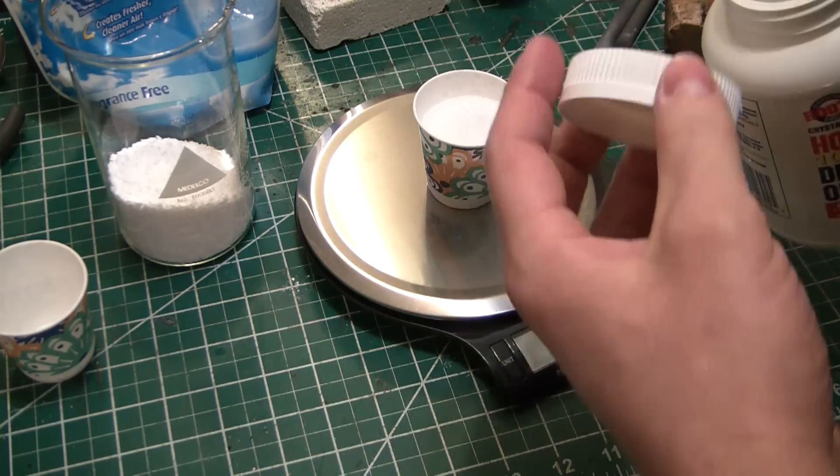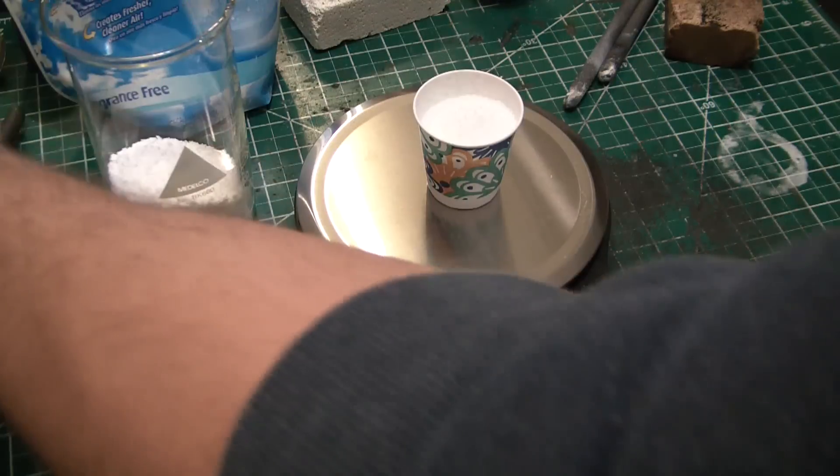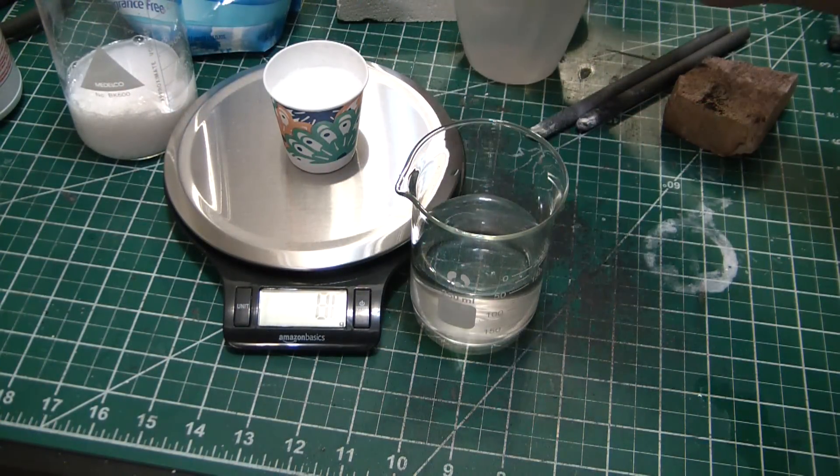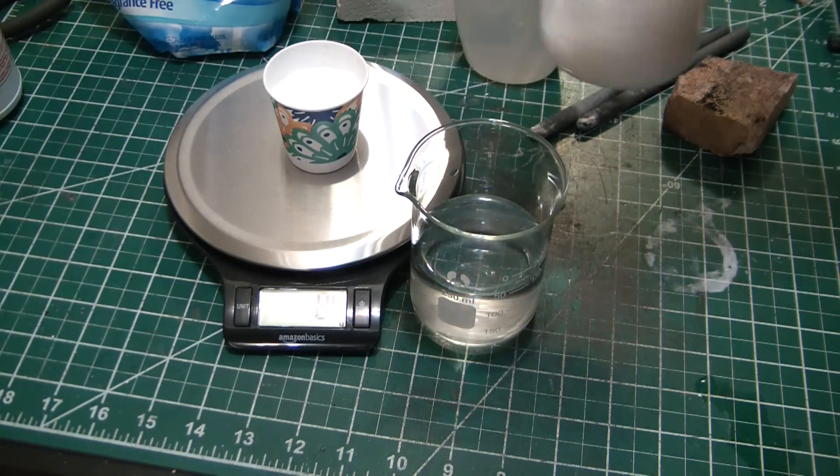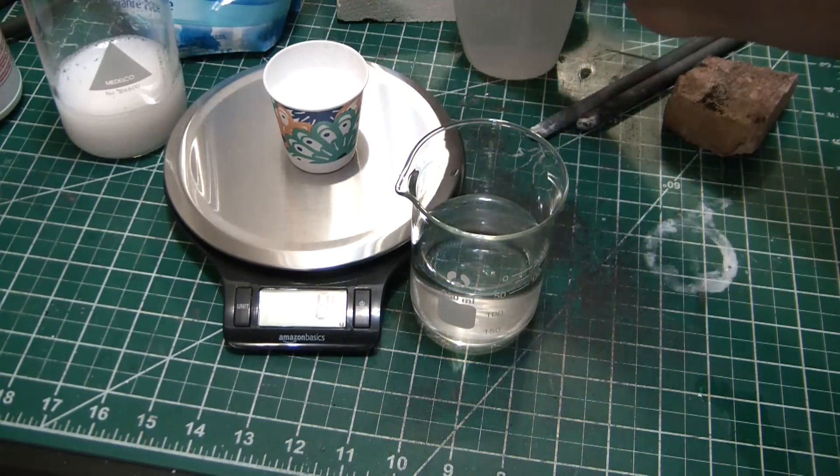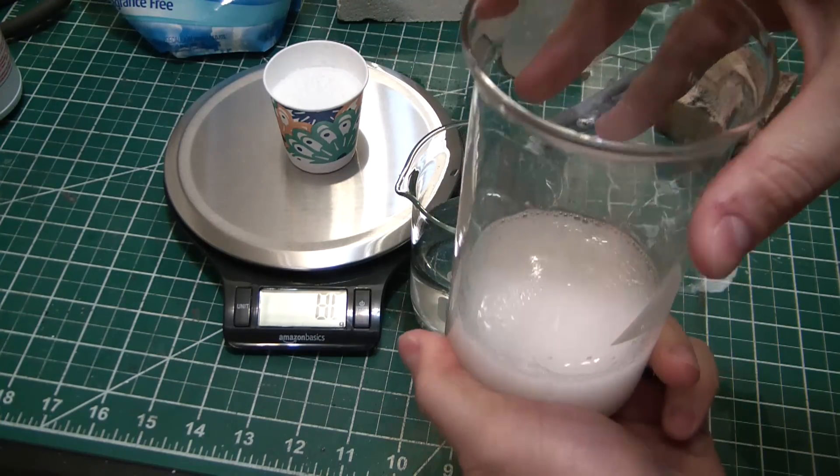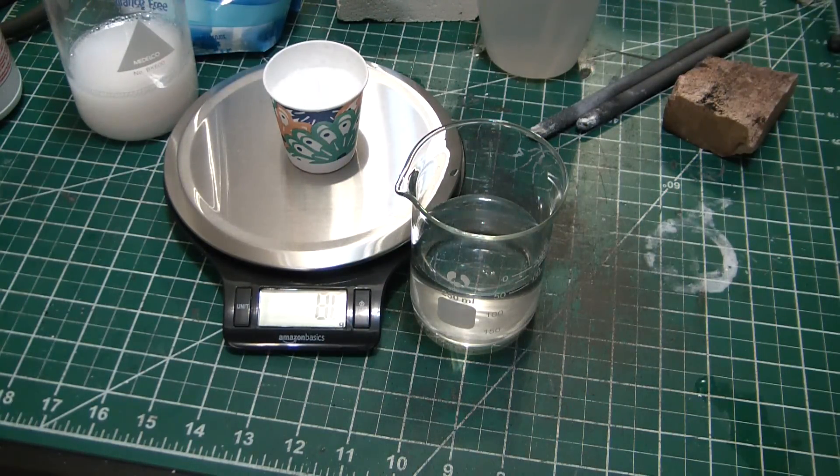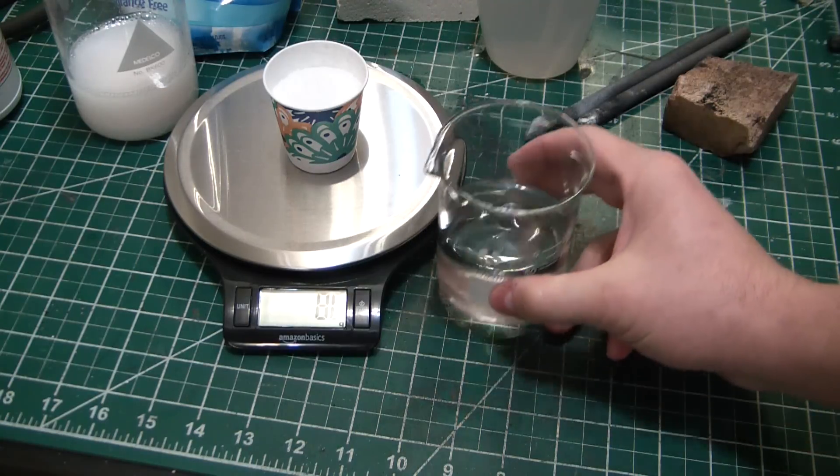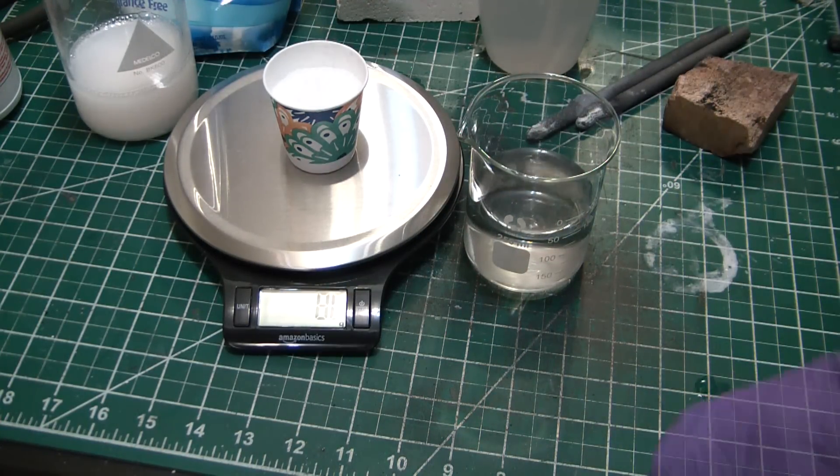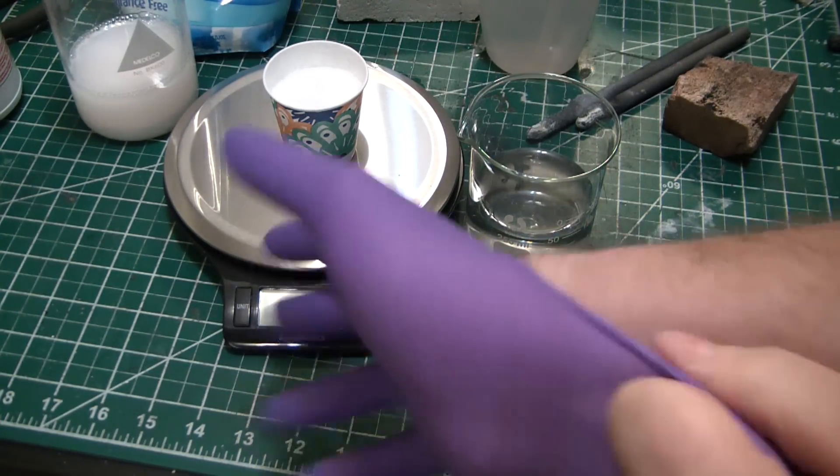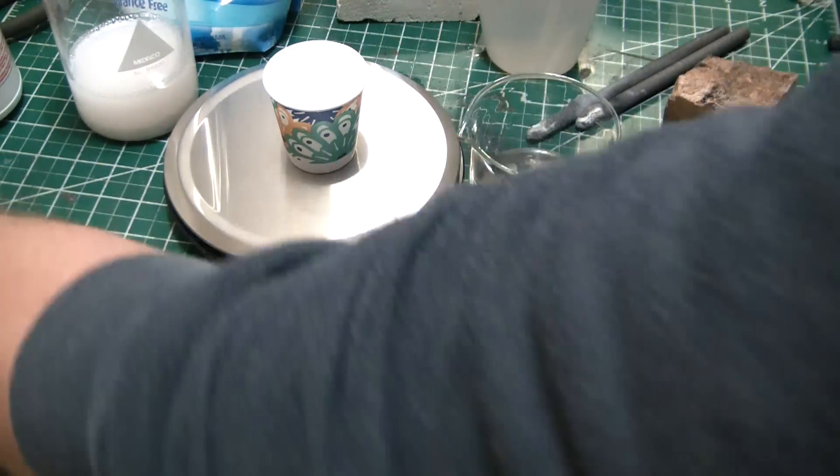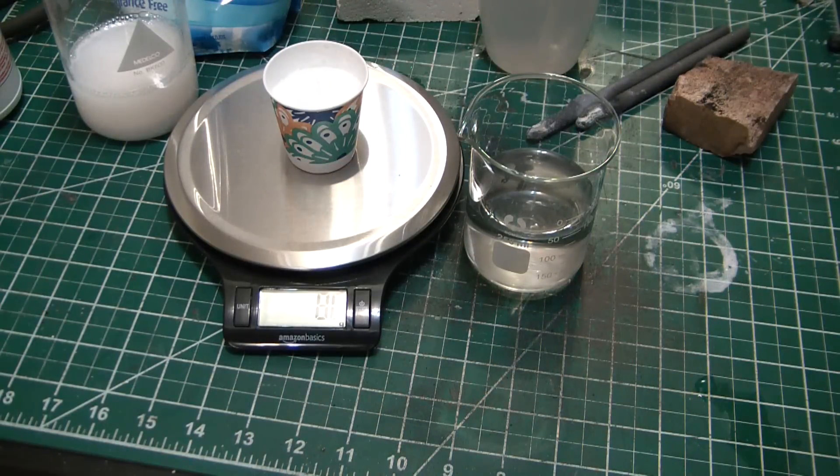Get both of our salts in solution here. They're both quite soluble, so you can do this in pretty minimal amounts of water. Both of them will make your water heat up quite a bit though. Calcium chloride not so much, but the sodium hydroxide - this might get close to boiling, so I'm going to have to add it slowly. I'm going to throw some gloves on that way I don't turn my hands into soap, and safety goggles so I don't turn my eyes into soap.